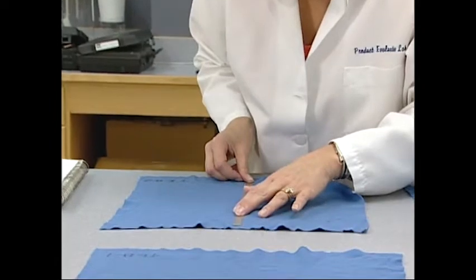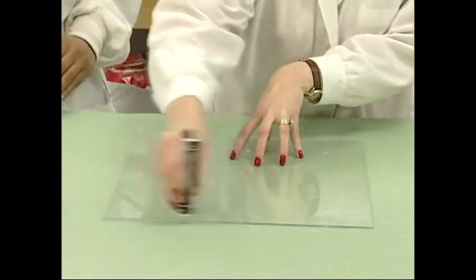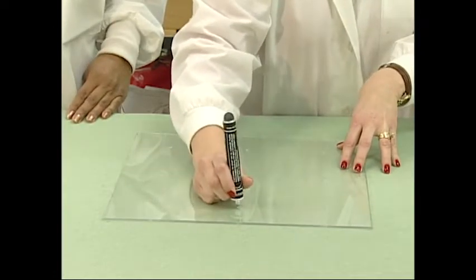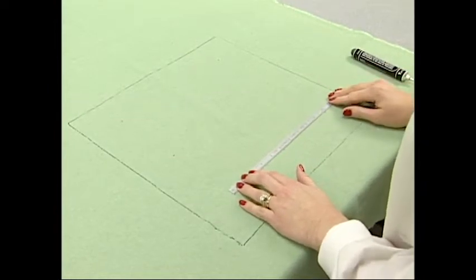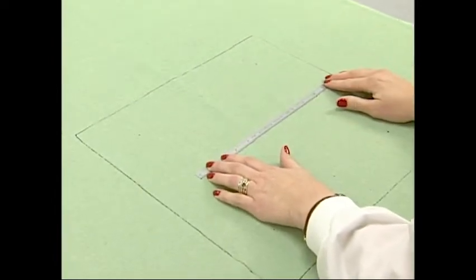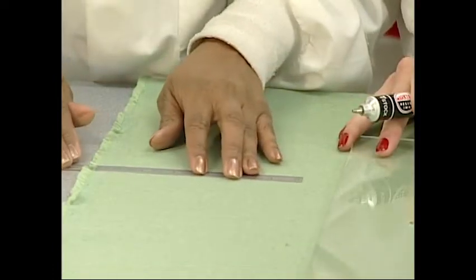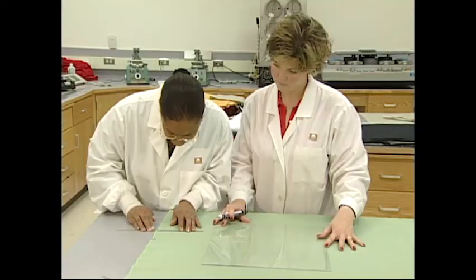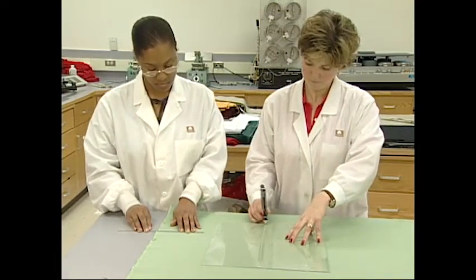The dimensional changes of fabric specimens subject to home laundering care are measured using benchmarks applied to the fabrics prior to laundering. Place the 15 inch by 15 inch square template on the fabric. Align the template's straight edges parallel to the selvages or width edges of the fabric, and to the top and bottom edges of the sample. Make sure that the edges of the template are more than 10% from the edges of the sample's dimensions.